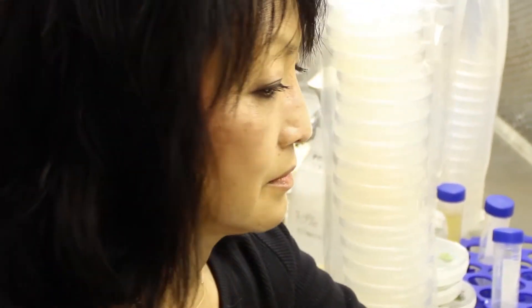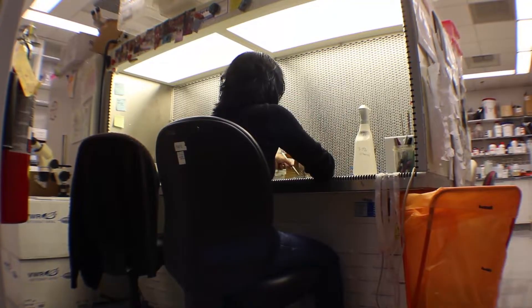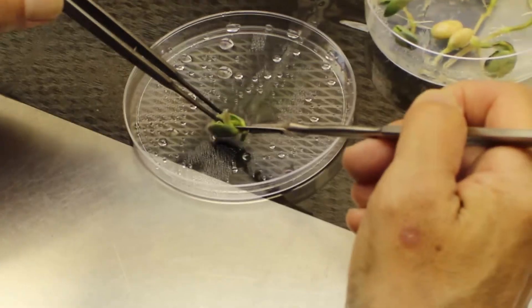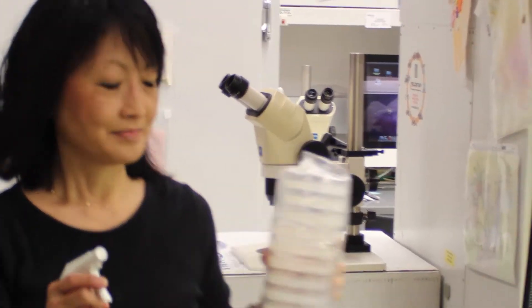What happens here is the researcher brings their gene, or we can synthesize the gene in the lab. We put it into the desired plant species and then give it back to the researcher for further analysis, or do the analysis ourselves. Today we're going to look at how we genetically engineer soybeans to introduce new traits.